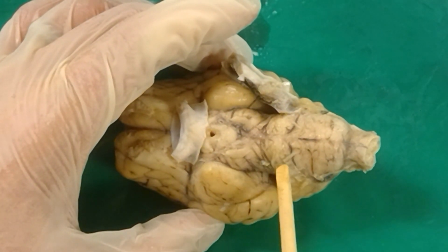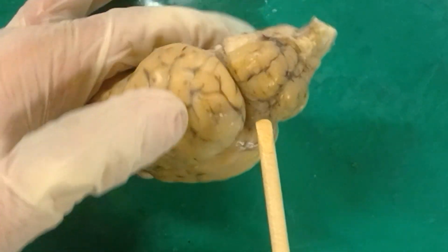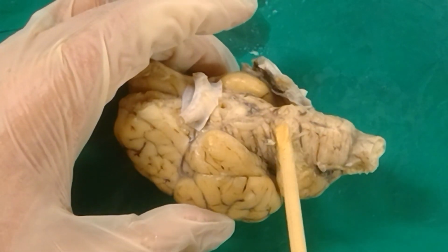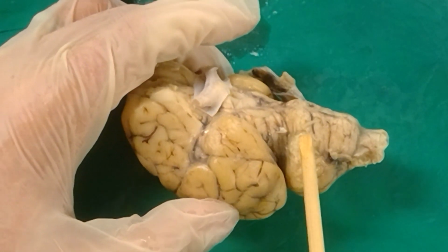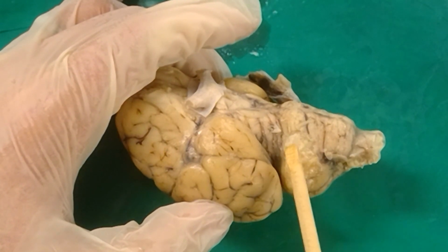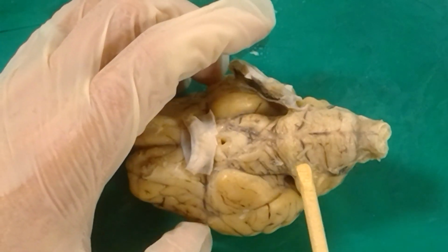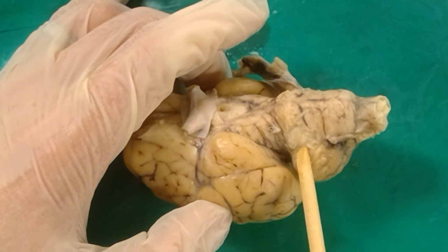this bulge right here, which is known as the pons. Together, the pons and the cerebellum make up our metencephalon. And the pons actually has a fiber bundle connecting it with the cerebellum so that they can communicate, which is known as the brachium pontis. Brachium meaning arms in Latin. I consider it the arms of the pons reaching out, giving the cerebellum a hug because they're friends. They like to talk a lot with each other, and they do that through the brachium pontis, which are these fibers running that way.